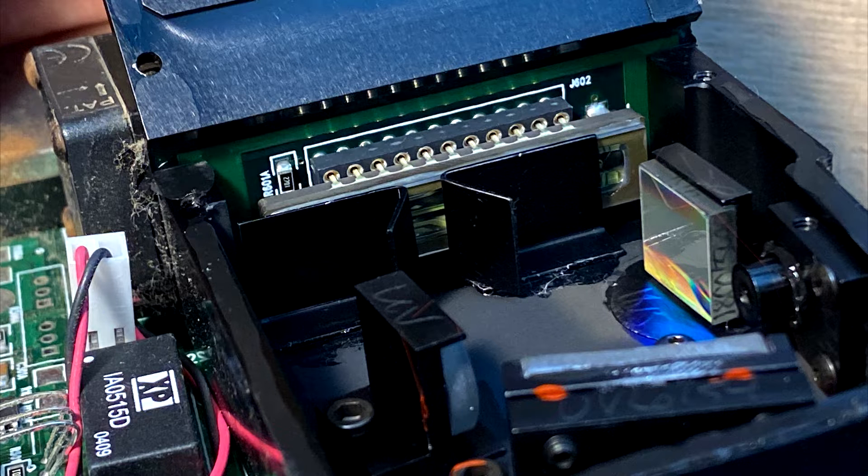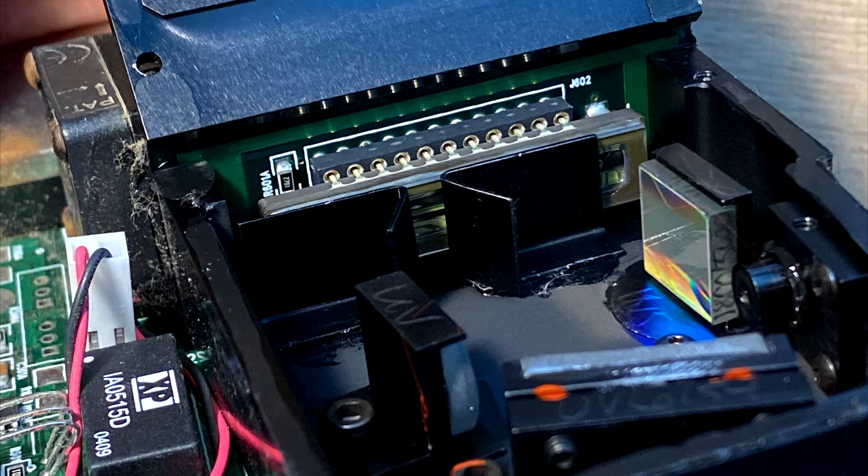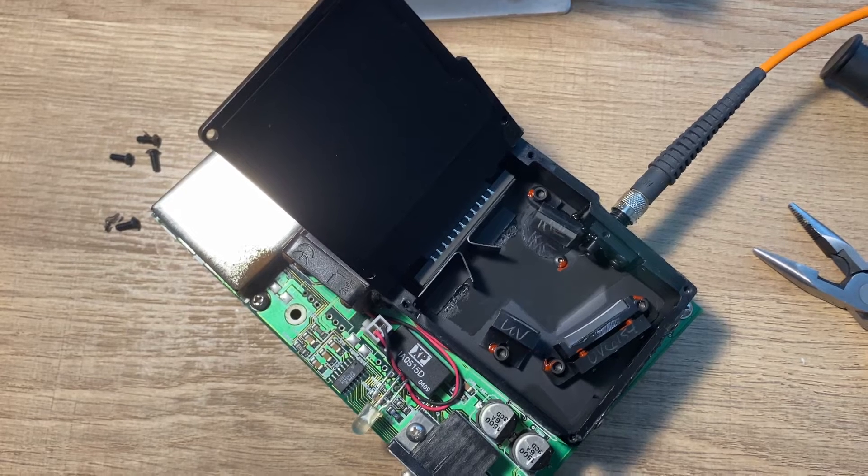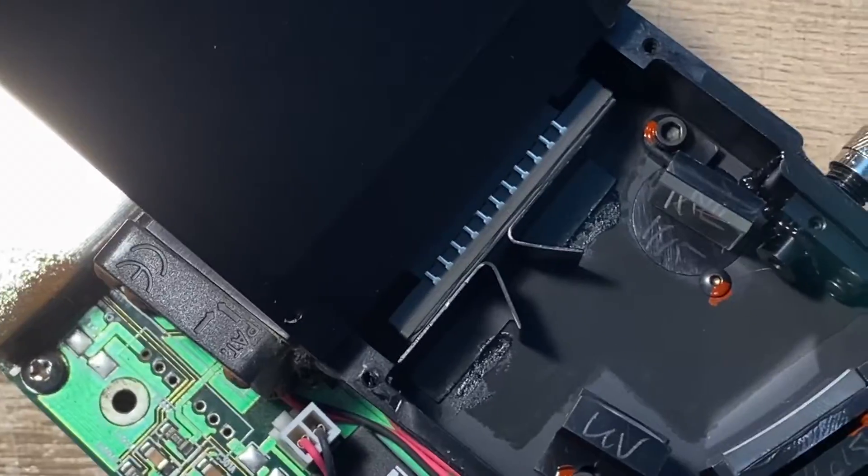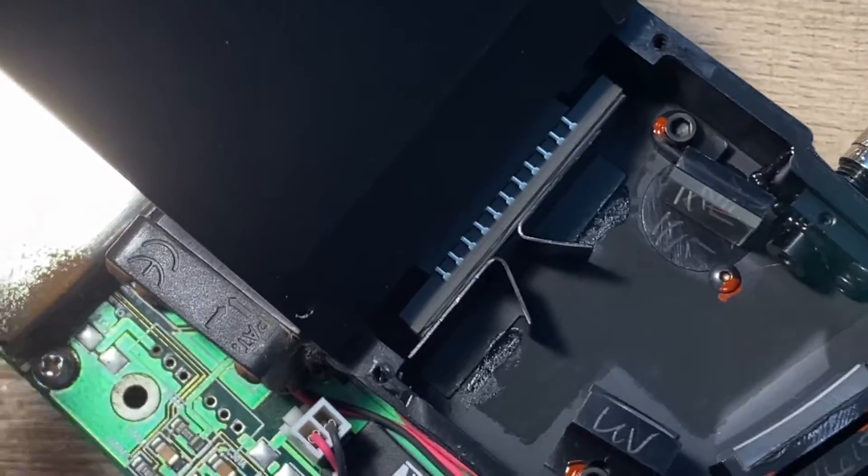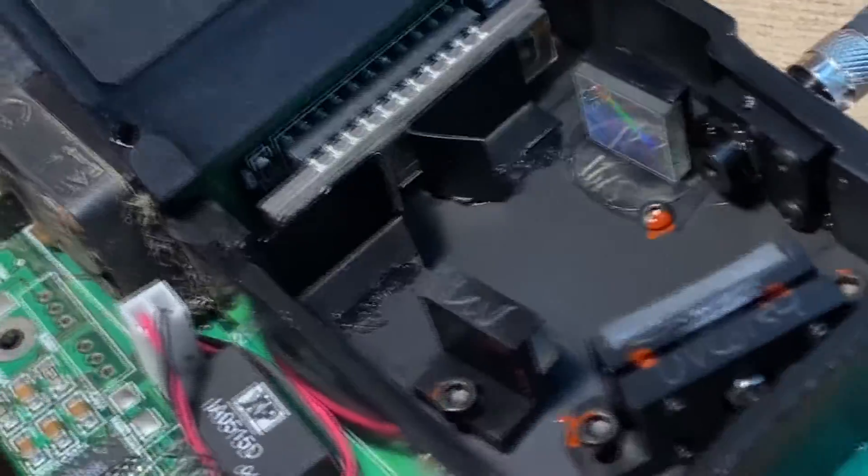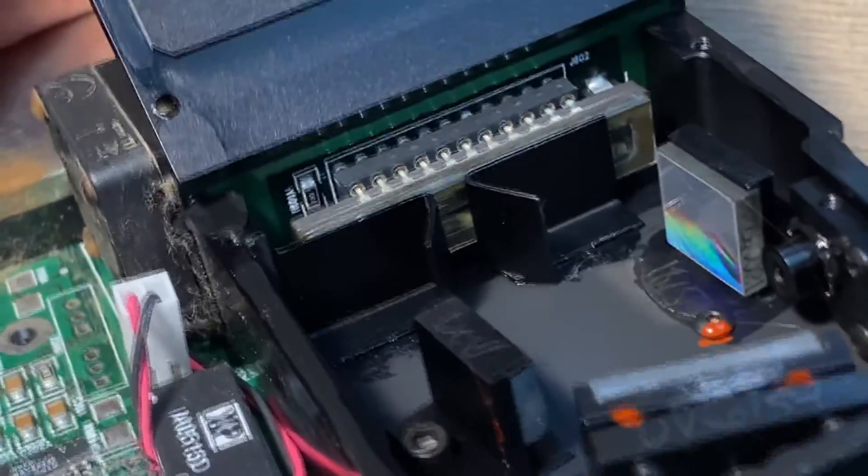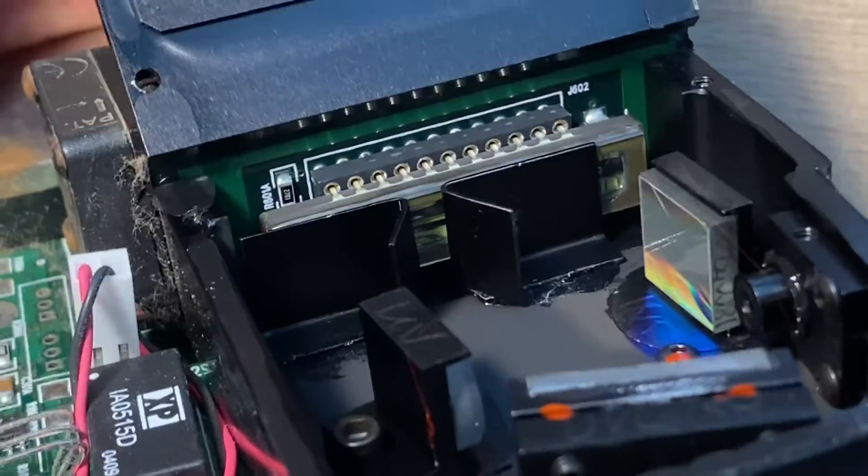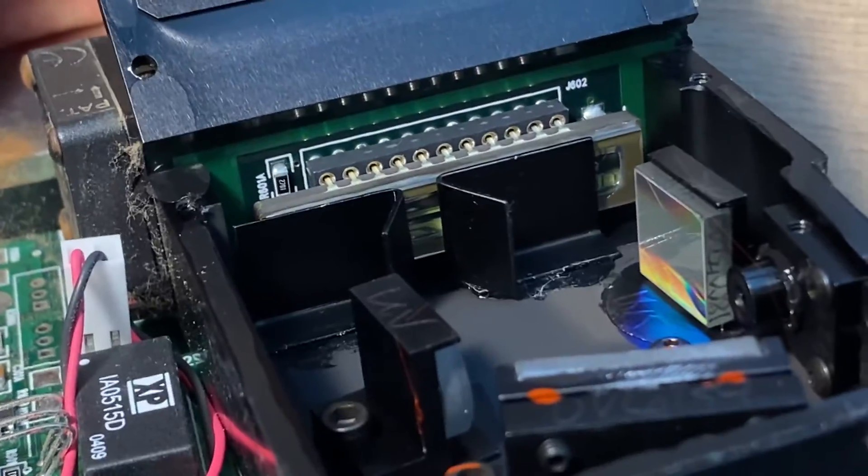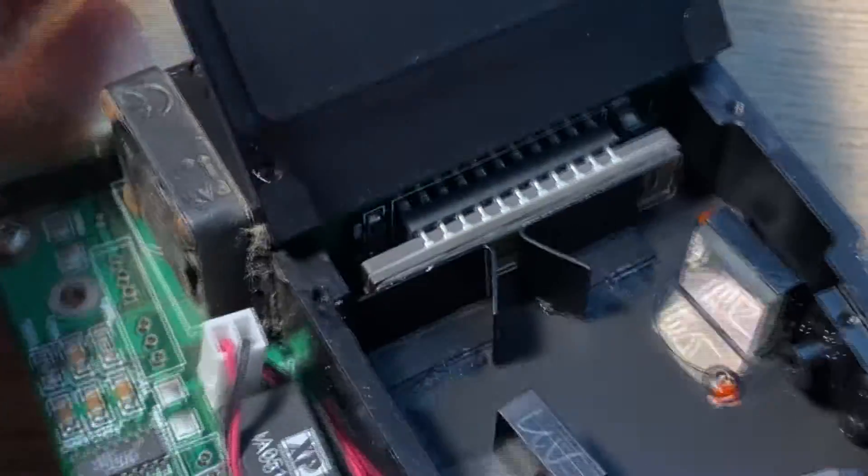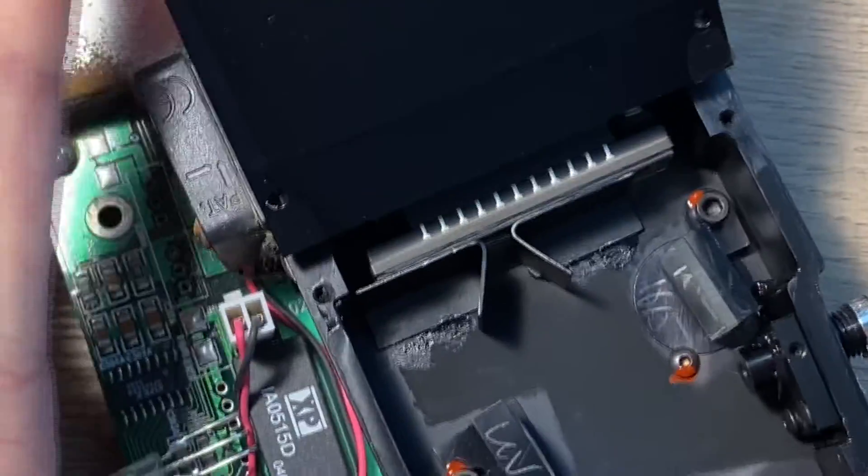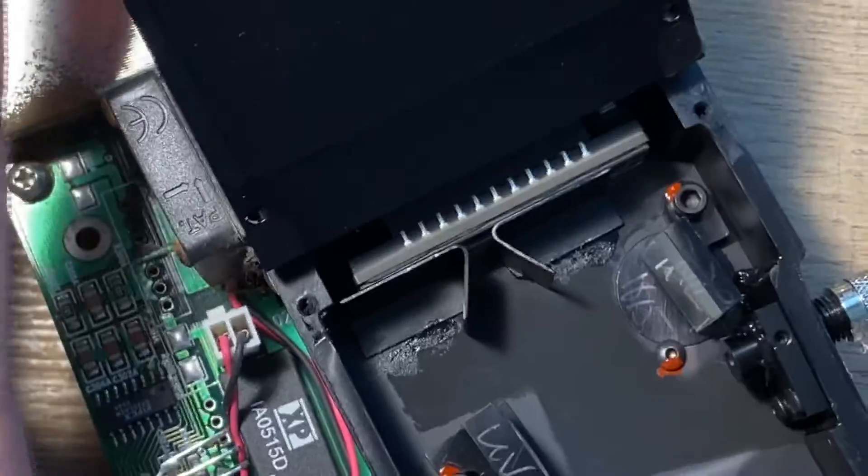When I tried to initially test it out using fiber optics and the receptor module, I noticed that these two black slits are blocking the rest of the CCD sensor. I really don't understand why they would do this unless they wanted a very specific spectrum, but ultimately this isn't what I wanted and I assume that this exposed region is the 600 nanometer to 900 nanometer regions.